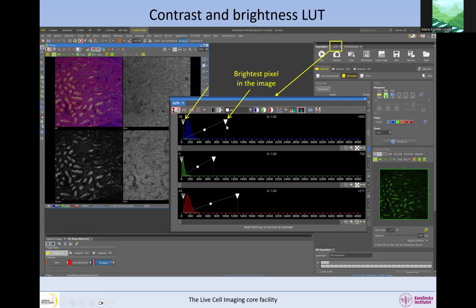This is the brightest pixel in the image, and 4095 is the maximum possible intensity at 12-bit. We don't have any pixels in this image at the maximum because there's no saturation in the image. Most of the signal is in here, but all the pixels from here all the way to the maximum, the brightest in the image, are actually pixels that are in the noise. All this is available in all software.